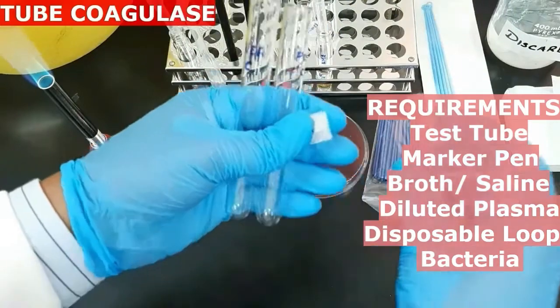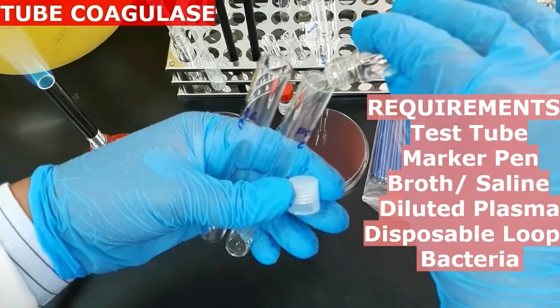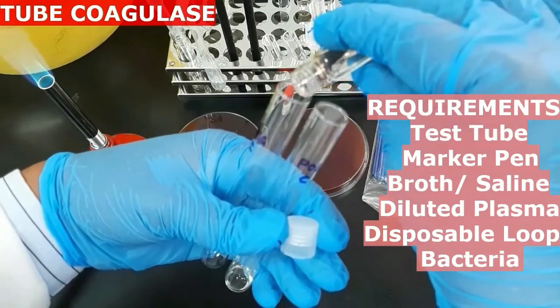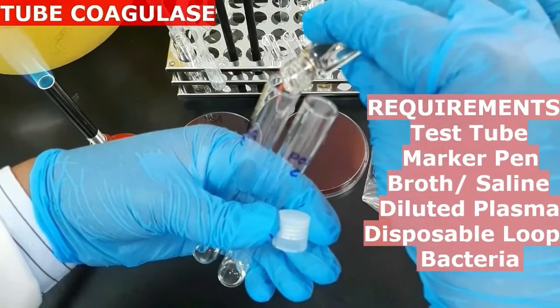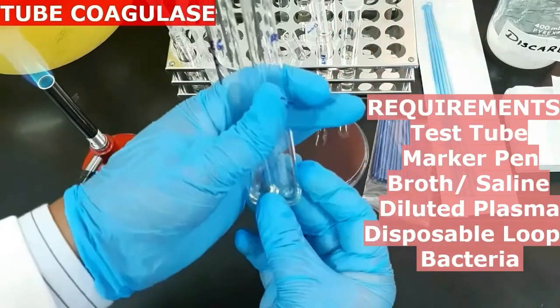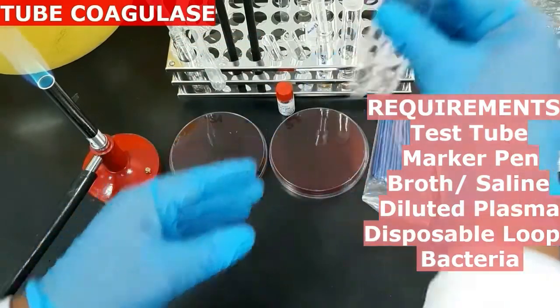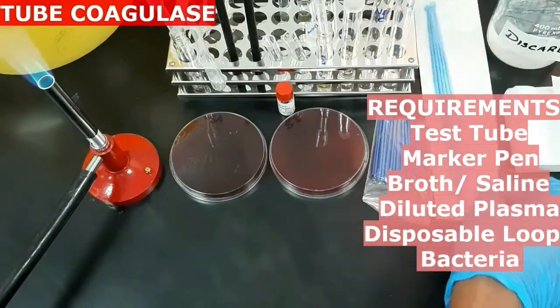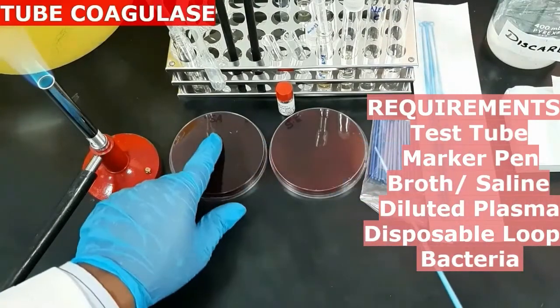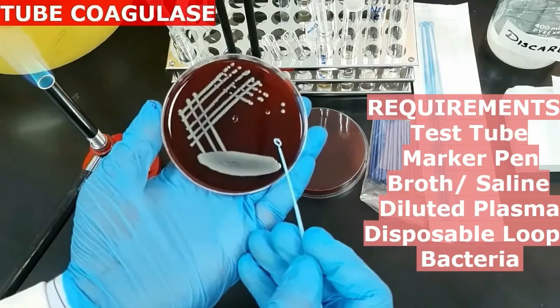So let's start the procedure. First transfer 0.5 ml of the saline or broth to each test tube. Transfer positive control bacteria to the first tube and negative control bacteria or the test bacteria to the second tube.